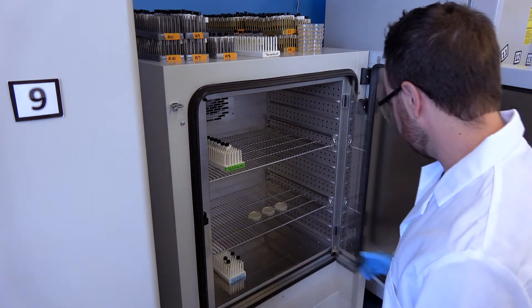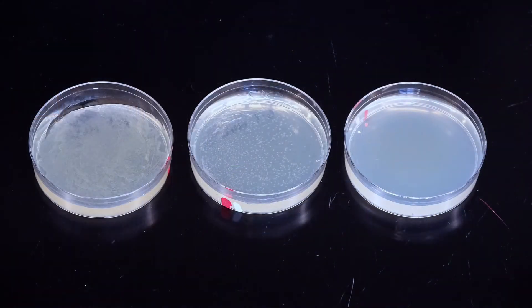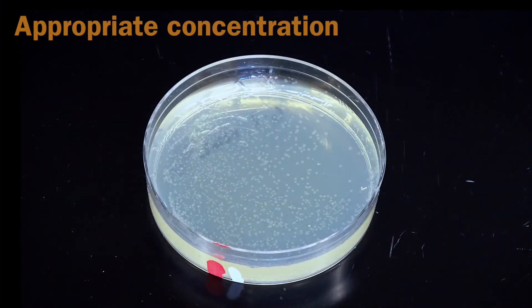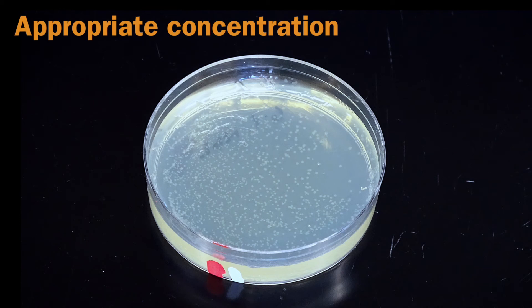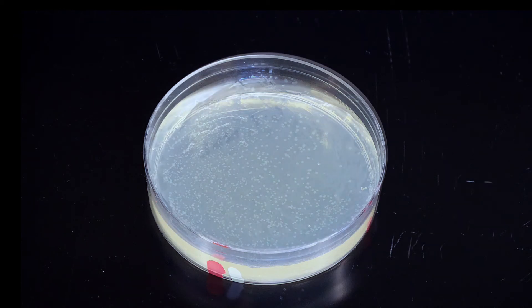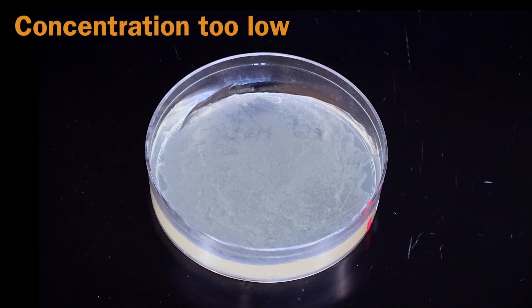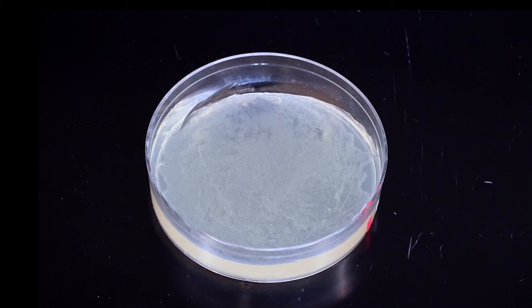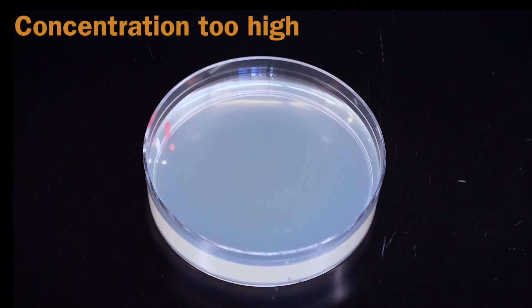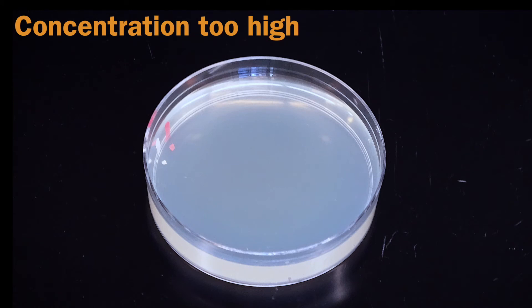After 18 hours, we observe our plates to make sure the transformation was successful. If we use the appropriate concentration of antibiotic, we should see many individual colonies. If we use too little antibiotic, we should see a lawn of bacteria, many of which are not transformed, and we cannot use bacteria from this plate. If we use too much antibiotic, we'll see little to no bacterial growth.